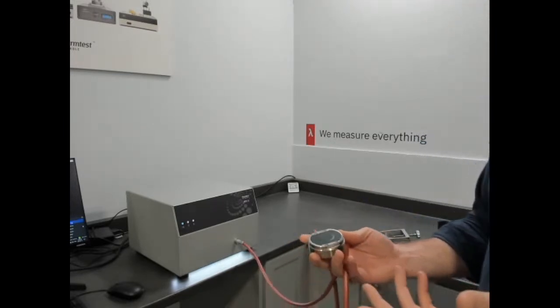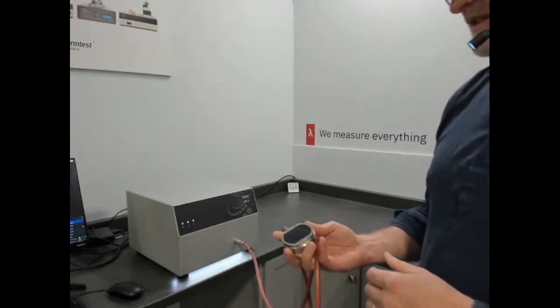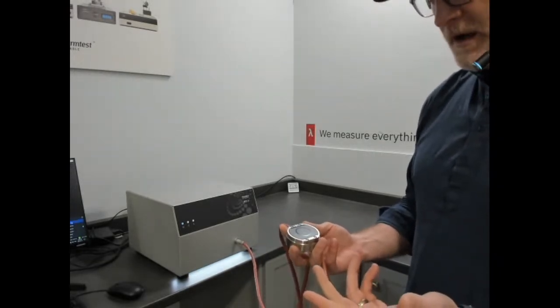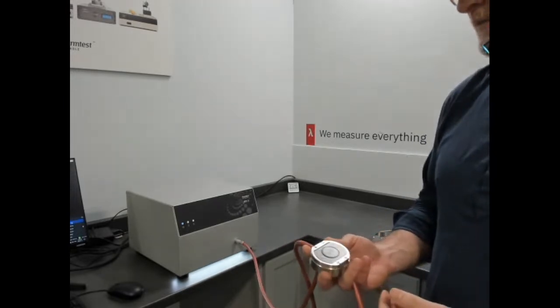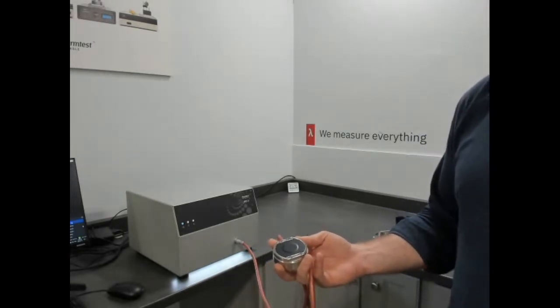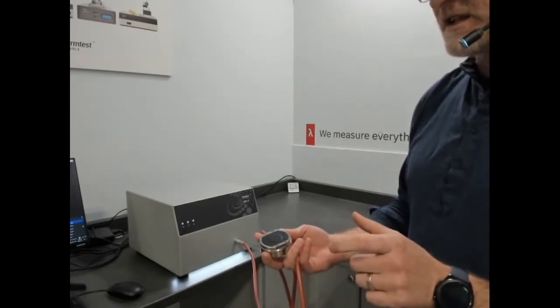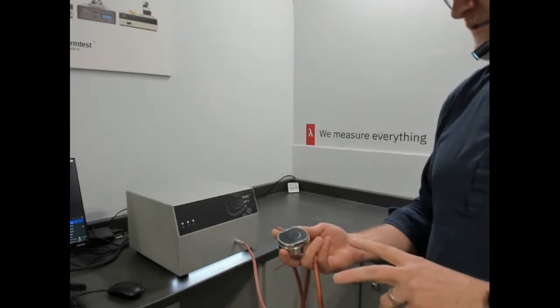So what is thermal effusivity? It's somewhat of a complex discussion, but at the same time it isn't. There's just some fundamentals to understand. There is an existing ASTM standard for measuring thermal effusivity, and it's 7984, and that's for the thermal effusivity measurement of textiles and fabrics. And it has a fairly narrow range of thermal effusivity, 35 to roughly, I think, 1100 or 1200 units of effusivity.